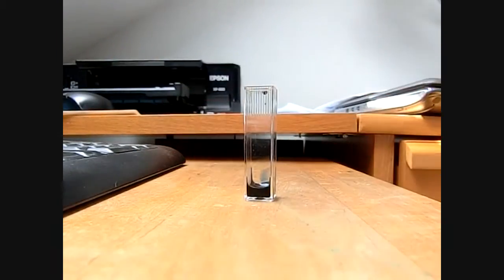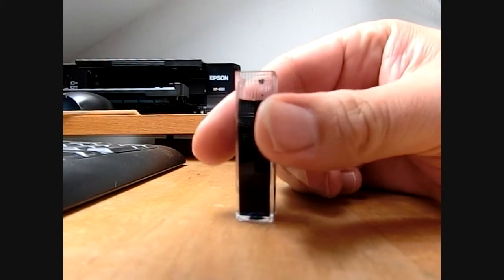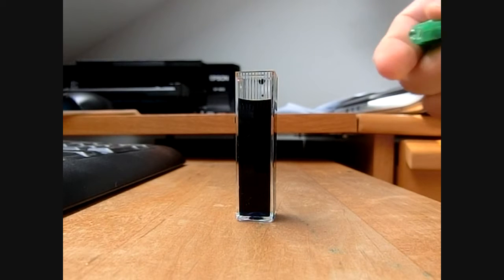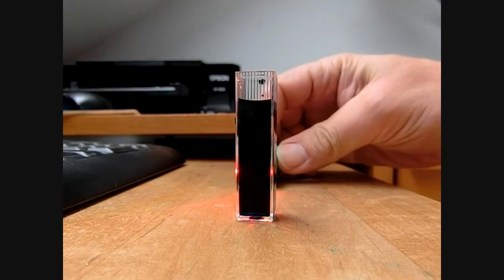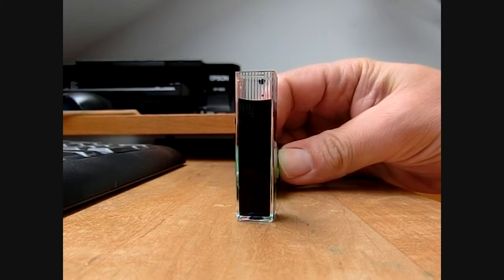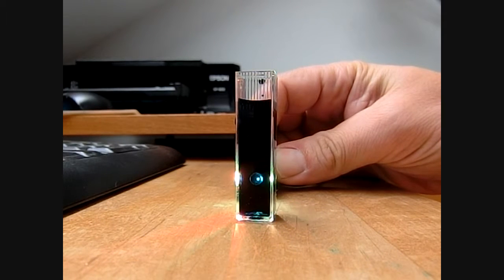So we have to dilute it a bit with water. And as you can see, if you now shine your light through this very concentrated solution, there is hardly any light detected on the other side. So even if you put the light source very close to the cuvette, there is hardly any light going through the solution.